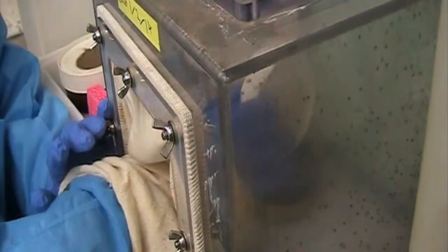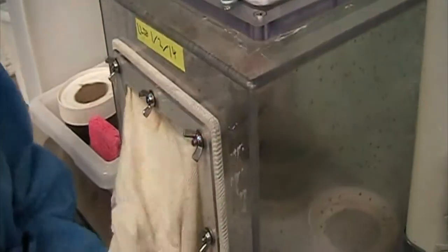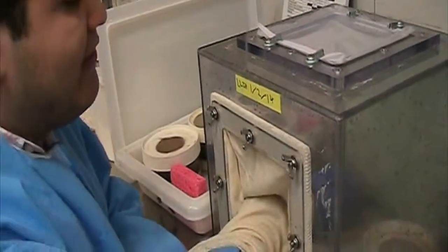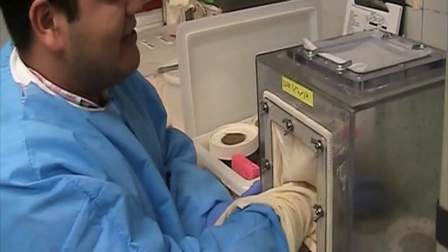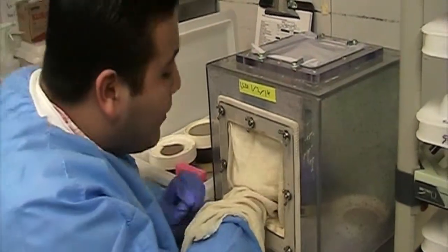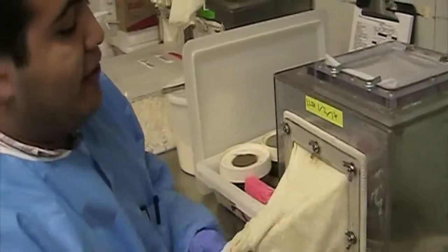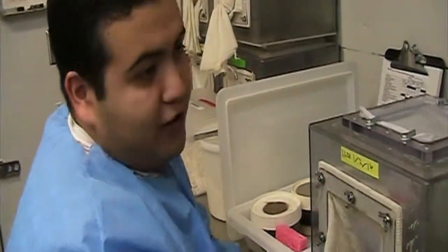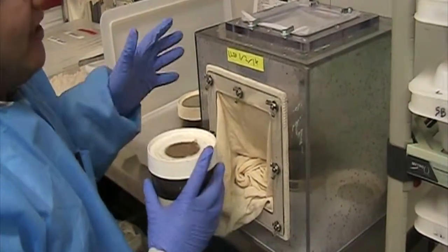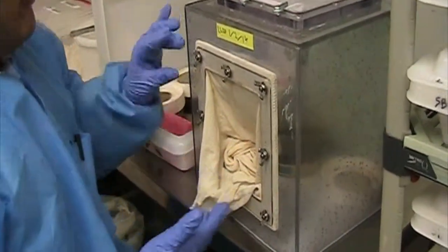Because if that happens, we will lose flies that will be emerging down here in the cage, and we do not want that. So we tap it inside the cage a couple of times, then let it go out. We blow on our hands so no flies escape. You don't want escaping flies, especially if you have a small colony — eventually you could lose around 200 per week. Usually we release around four pots per cage, and we leave it in there for roughly a minute or two.